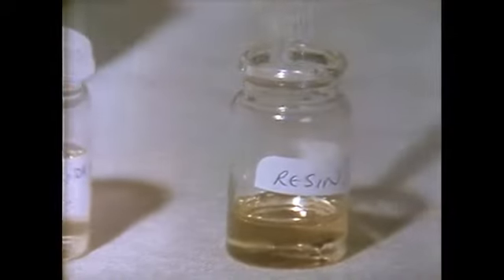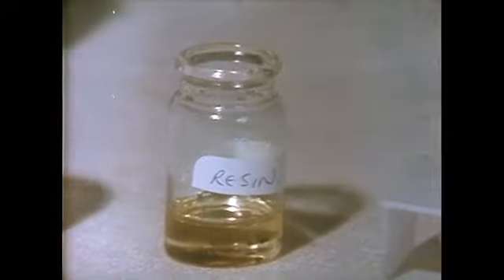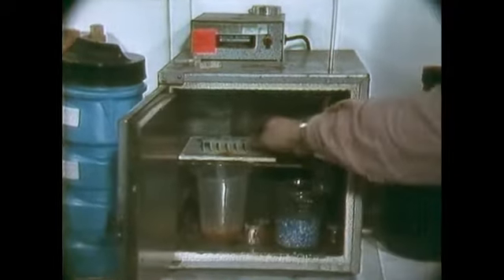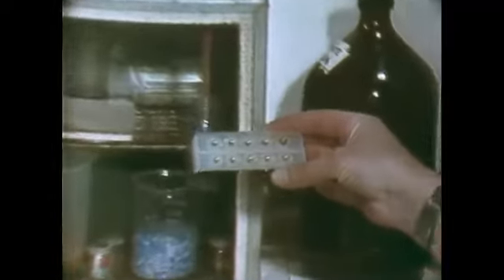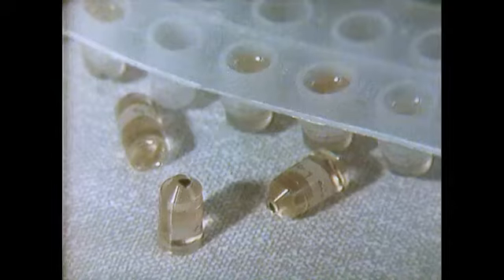Once dehydrated, it's transferred to resin. It's then put into a small mould and placed in an oven to polymerize. The viscous resin hardens, and the tissue, the black material in the resin, can now be sectioned.